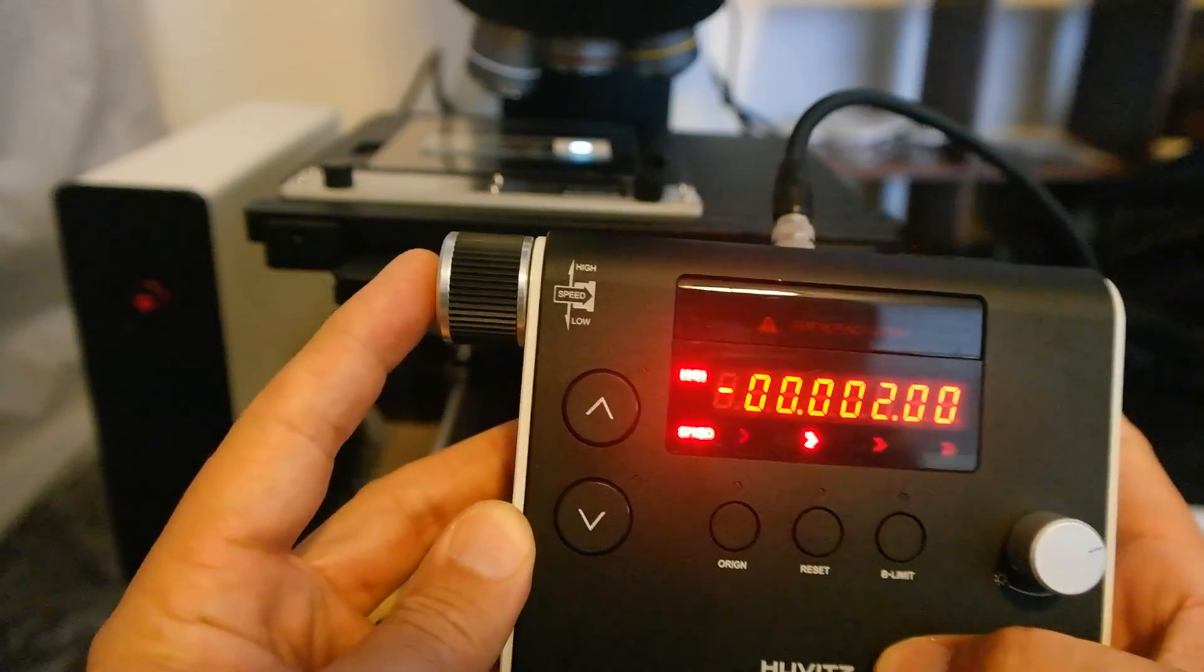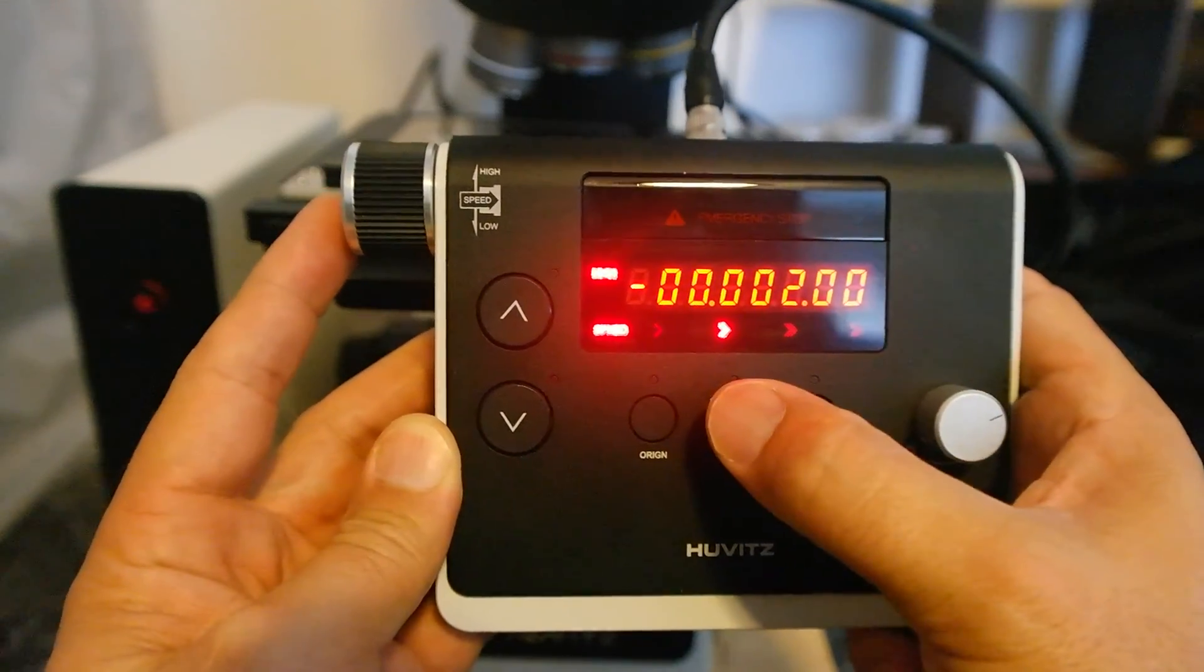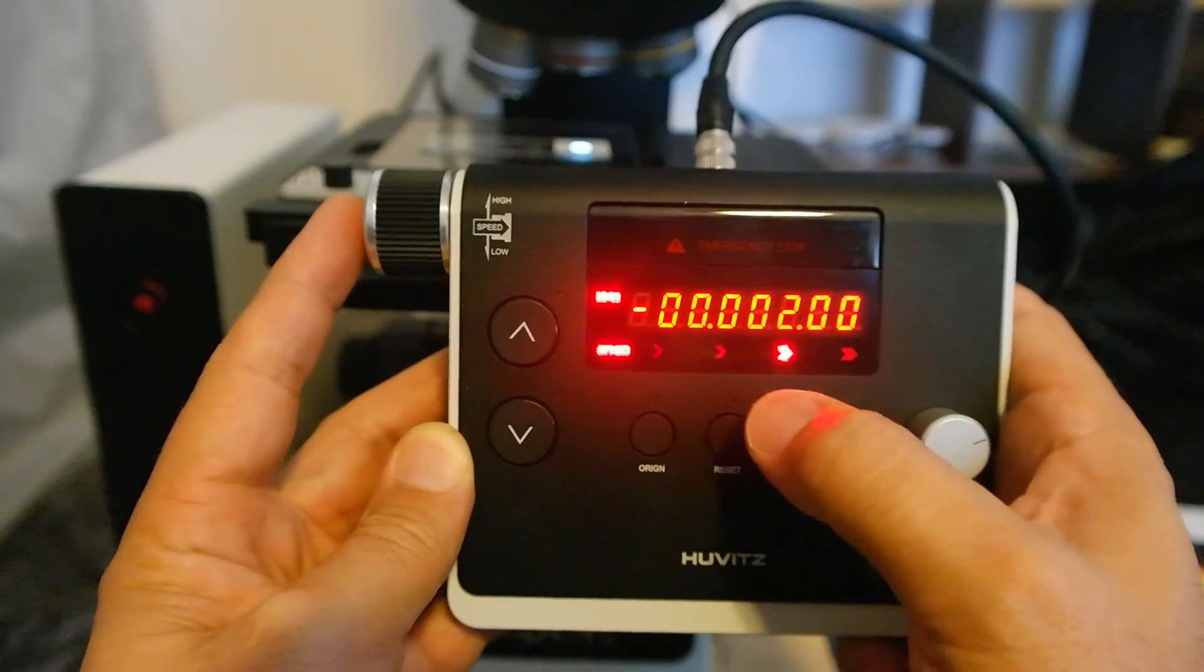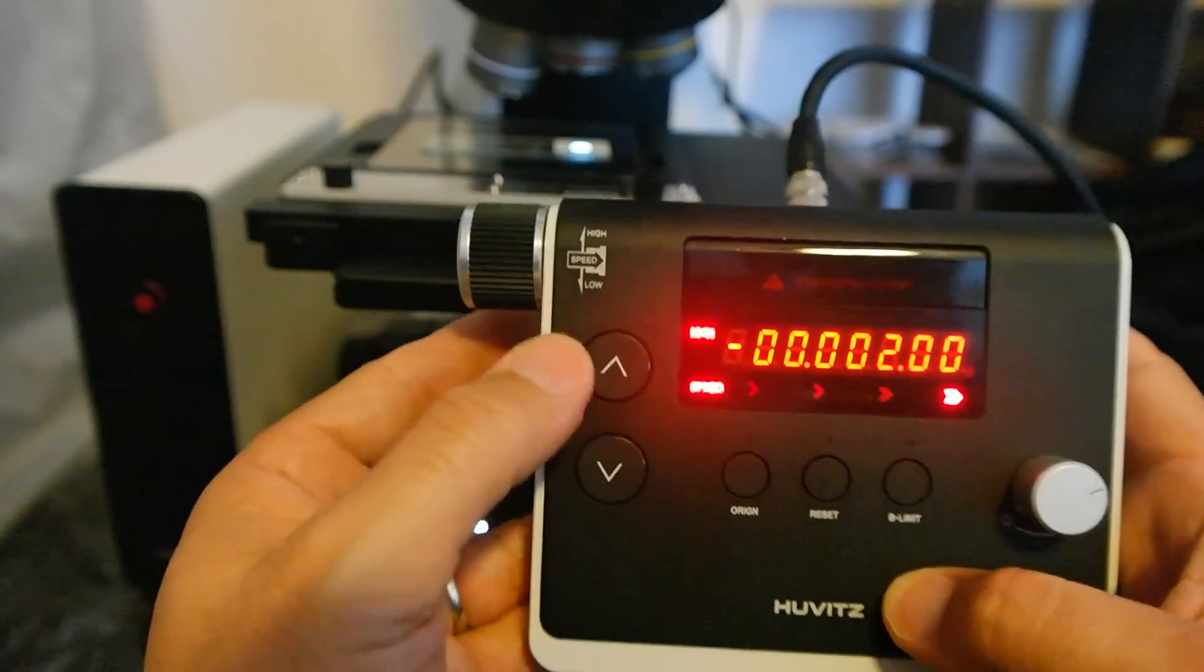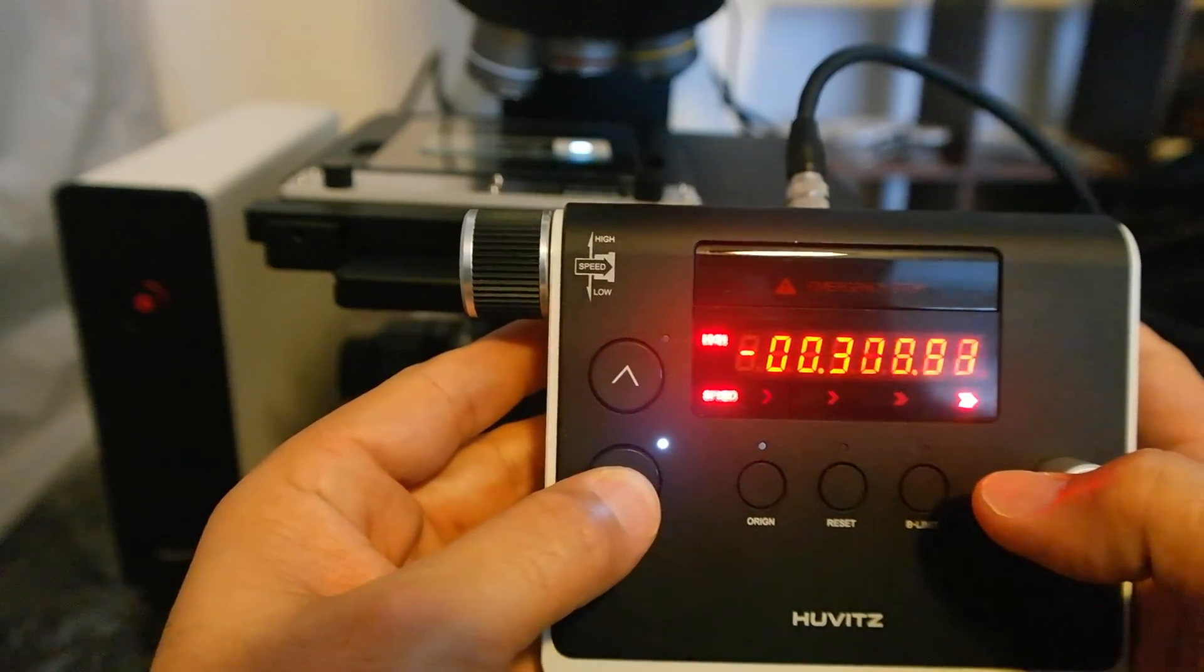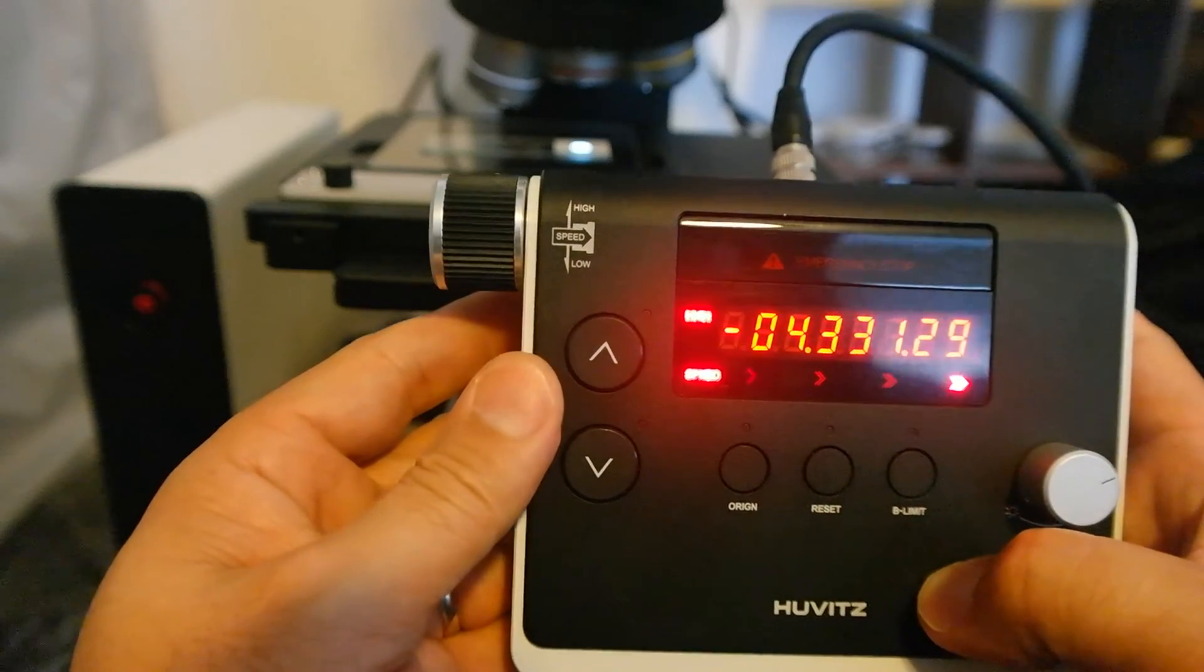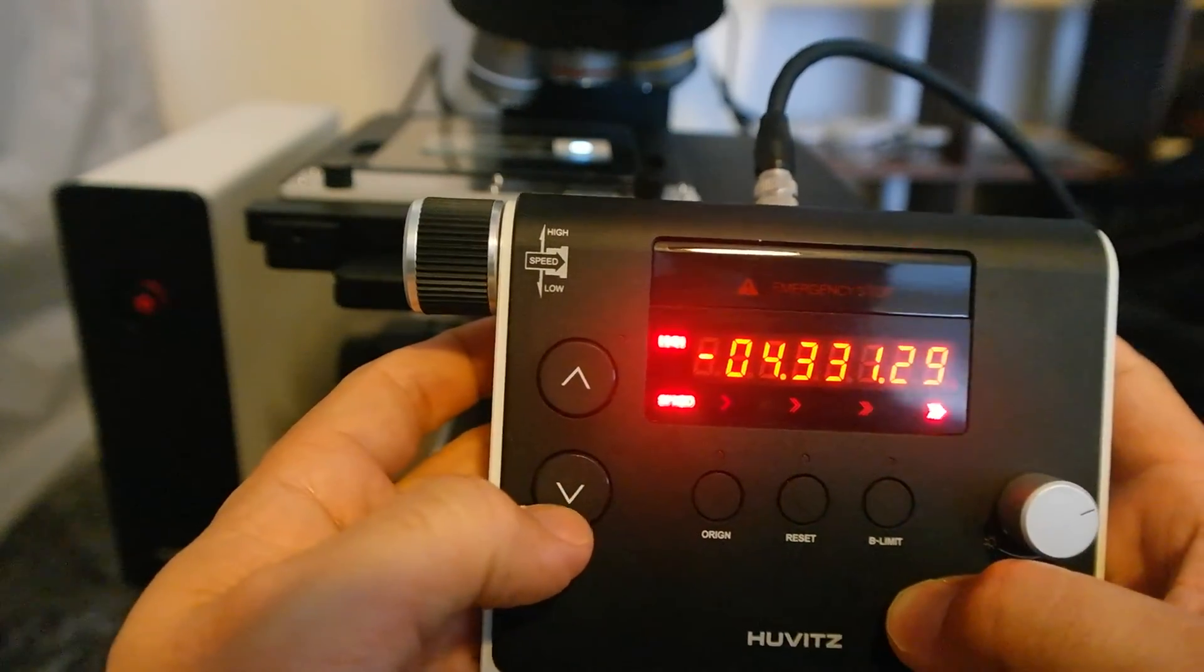If you push on this button you will see here the indicator of speed, and that changes from 1, 2, 3, and right now 4. And also you can use these buttons to move up or down manually. As you see right now I'm at the fastest speed. It goes very fast to up. As I said it was 1.4 millimeter or 1400 microns per second.